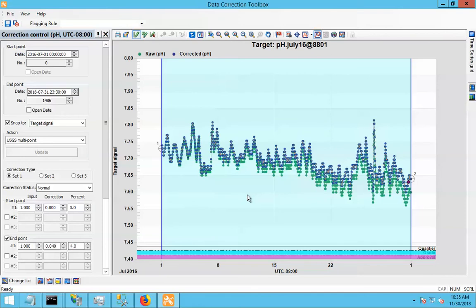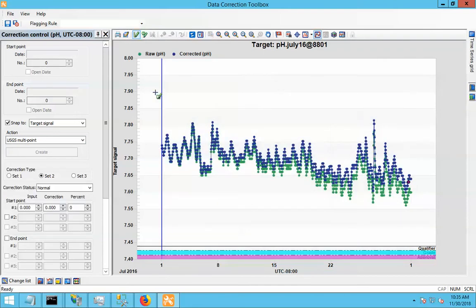Now that I've put in my fouling correction, let's pretend that I took my sensor back to the lab at the end of this period, and I tested it against my standard pH solution and now I have calibration corrections that I want to apply for this section of data. Let's put that in. So we'll start another USGS multipoint correction. And this time we'll be set 2, because we're going to do a calibration correction.